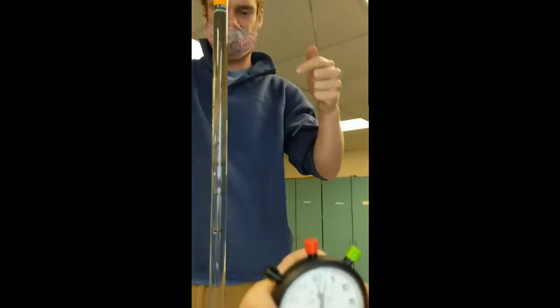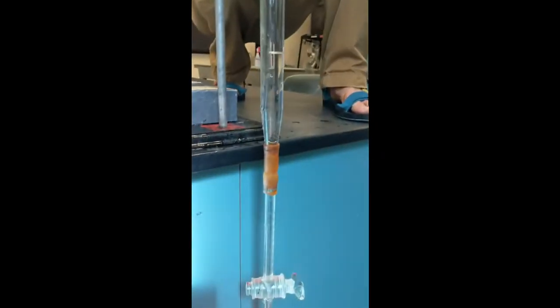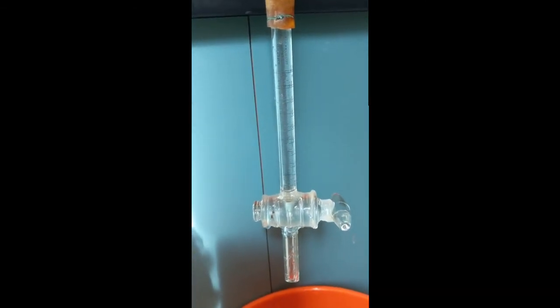All right. And then we see our mud settling down through our tube. One thing to notice here is the lesser accumulation that occurs as we're hitting our initial intervals. We already passed 13 seconds, and we're passing 19 seconds right now. We have nothing yet accumulated in the bottom of our tube.